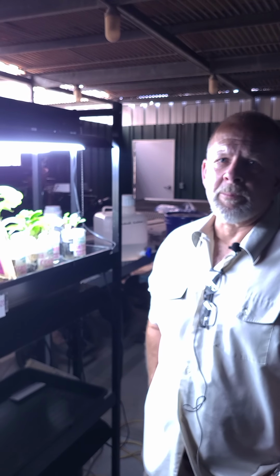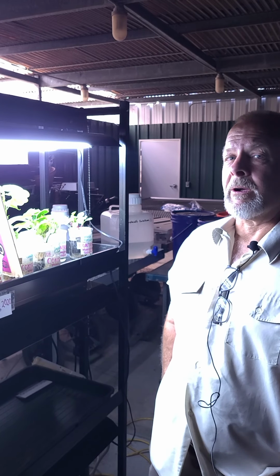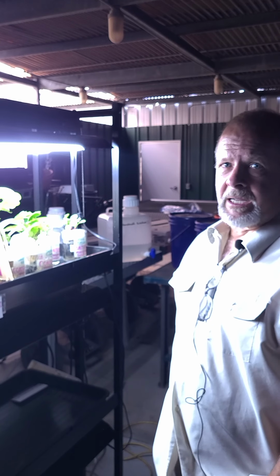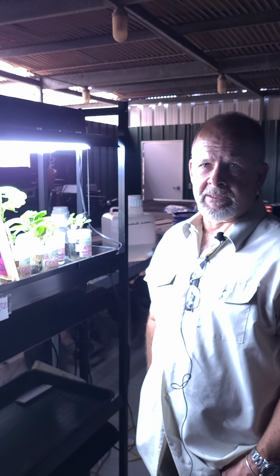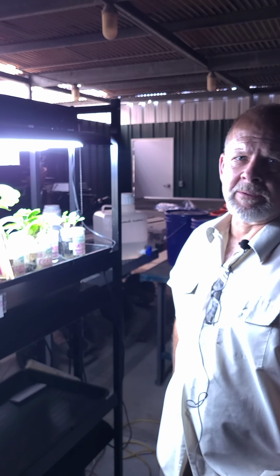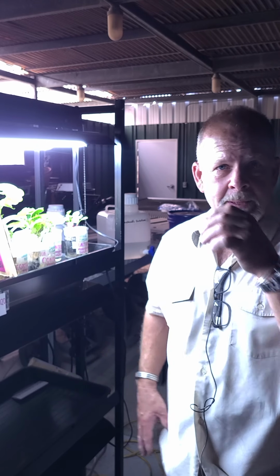This is AGNR 131 Lab Exercise 4, Part 2, Effects of Soil Salinity on Plant Growth. And we are at the end of week 1 on this. So what we're going to do is show you what's gone on so far after a week of these 5 different plants, sitting in the varying levels of soil salinity, or not soil salinity, but solutions with different levels of salinity: low, medium, and high.